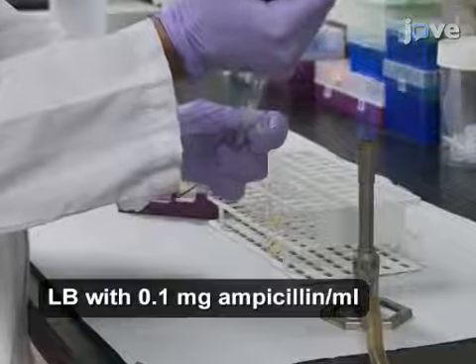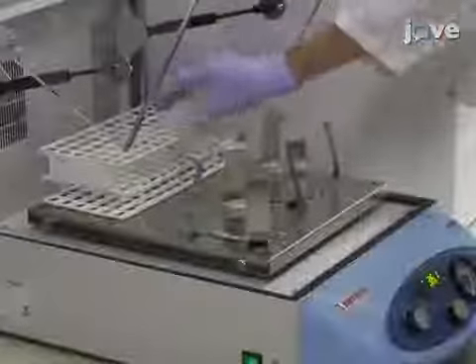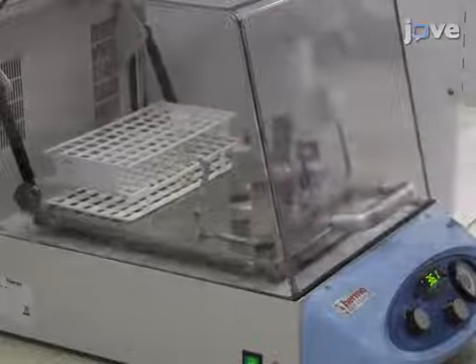Inoculate 5 milliliters of sterile lysogeny broth with a BL21 MOG-tag glycerol stock and incubate it overnight at 37 degrees Celsius and 200 RPM.